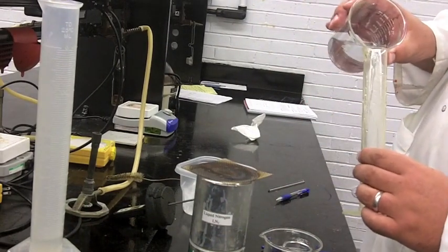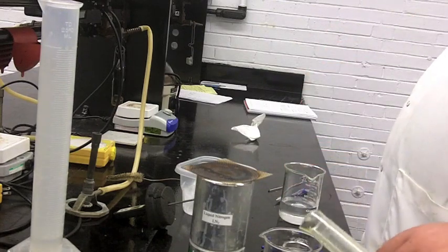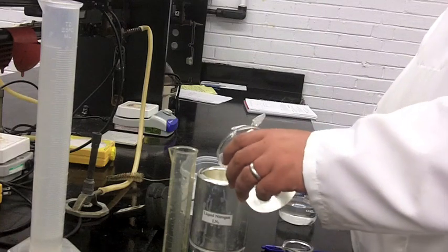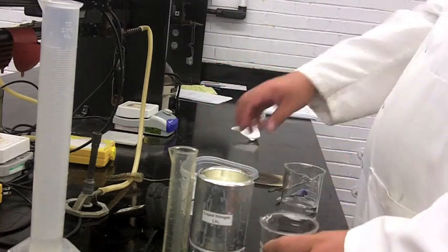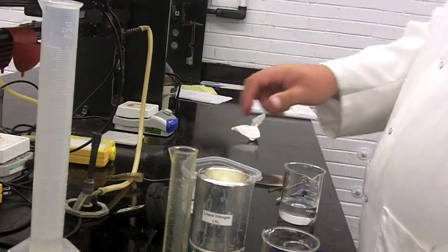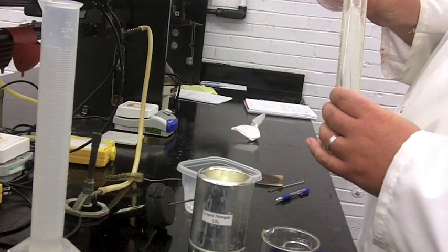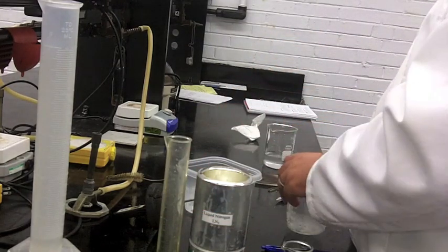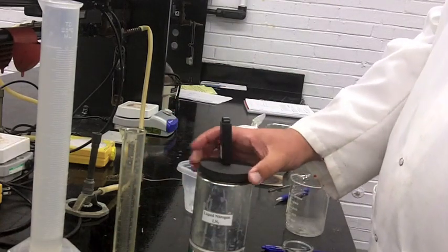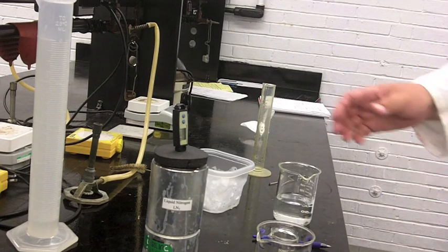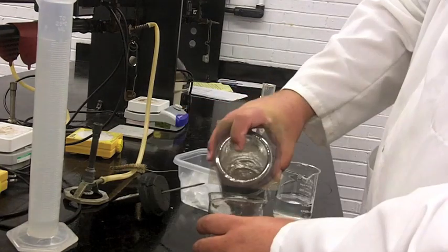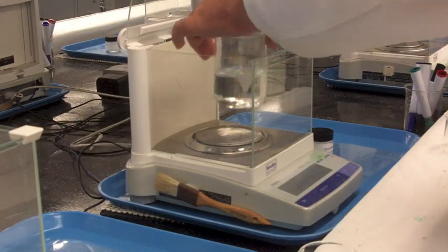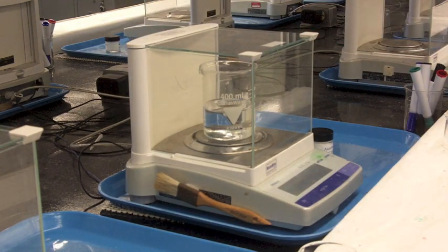At that point, I went ahead and used a graduated cylinder—you don't need to. But I added a little bit more water, maybe 50 mLs or 20 mLs. You want to make sure it's not too big for the dewar and ideally low enough that you can still put it on the balance. Then you'll need to chuck in some more ice and do the equilibration again. This time I added probably another 75 mLs of water or something like that. If you think about what you're doing, you're diluting the solution so the molality is going to go down, and the temperature depression should not be as much as it was the first time. You're going to allow it to equilibrate again and repeat the same experiment with filtering it and measuring the mass. You'll have two molalities for each substance—two for the liquid and two for the solid—and then you can compare those two and see if they are in agreement.